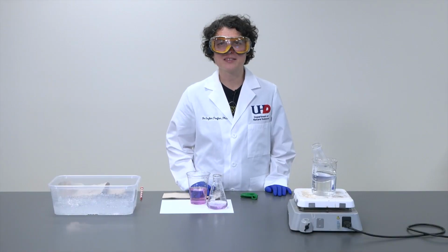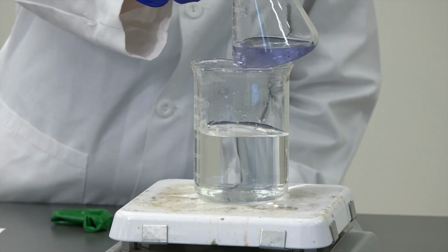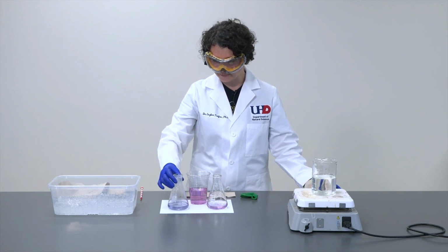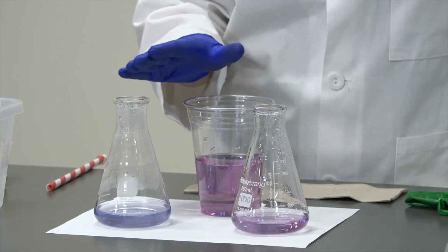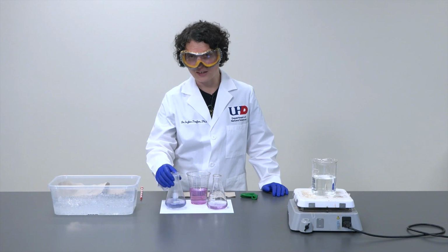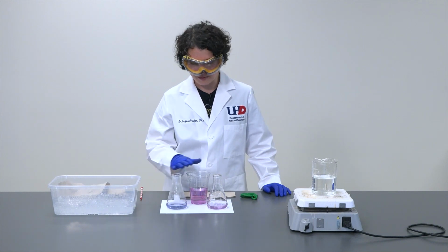It has been approximately 10 minutes since we submerged our Erlenmeyer inside the hot water bath, and we are already noticing a color change. It has shifted from more a pinkish purple to a closer to bluish purple. So from this experiment, we should be able to derive some conclusions. If our red cabbage solution is turning bluish and then later other colors, that is going to be an indication that it is shifting closer to neutral and potentially further from there.